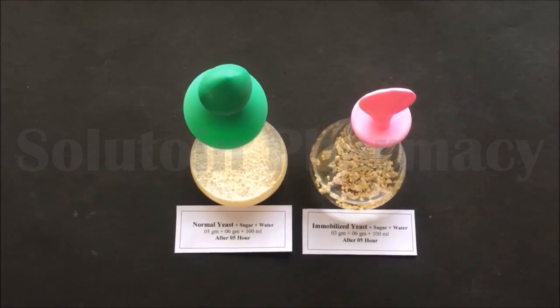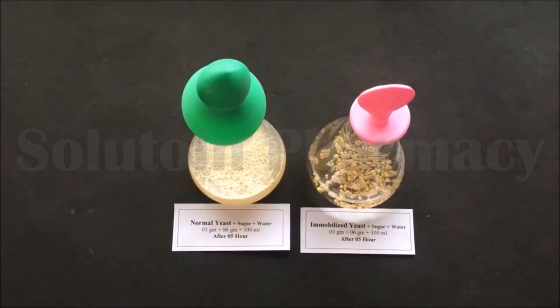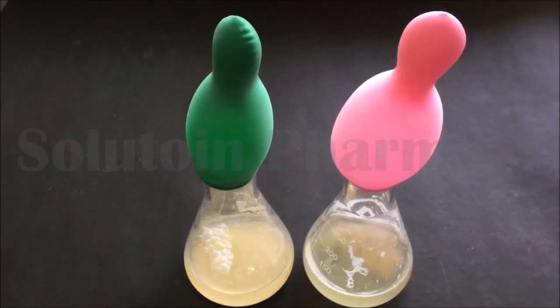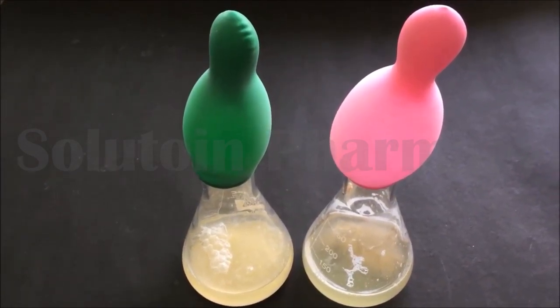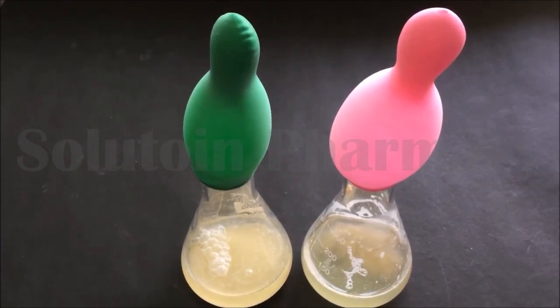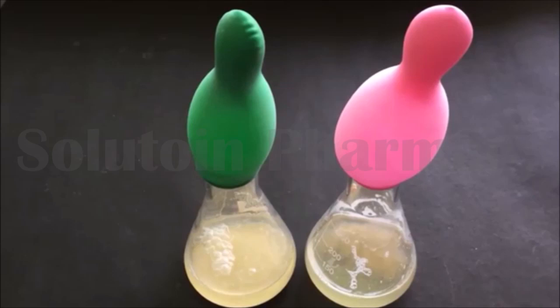After 5 hours you can see that the fermentation process starts in the left side conical flask containing unimmobilized yeast cells, causing the balloon to inflate due to carbon dioxide released during fermentation. After one day you can see that fermentation starts in both conical flasks, but the right side flask containing immobilized yeast cells has a higher fermentation rate, with the balloon inflating more compared to the left side.